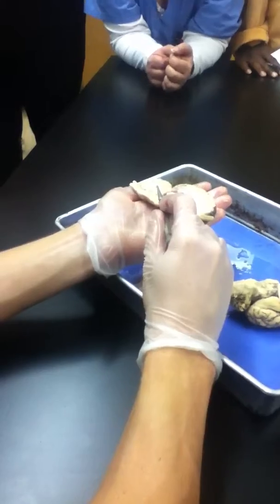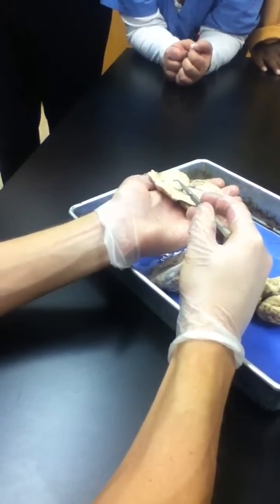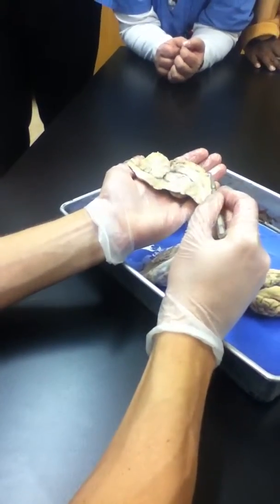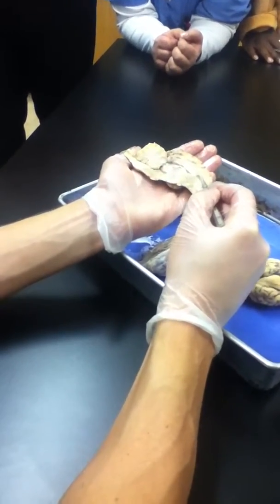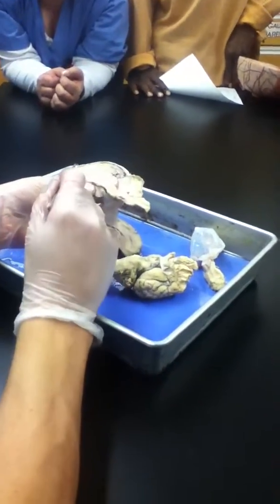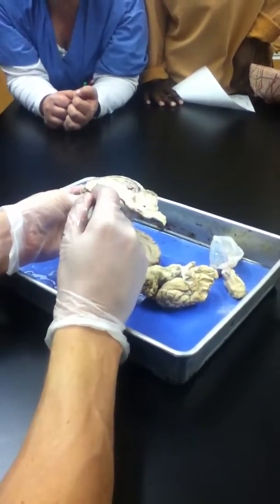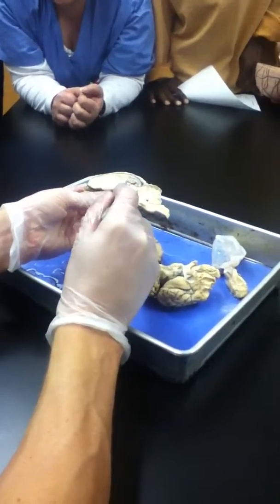Now, notice how that was white matter. You can clearly see the difference between outer gray and inner white matter. And because they went a little off-center with their slice here, you can actually see the difference between gray matter here and lighter white matter here. Now, it wasn't perfectly dissected. It's a little better on this side. And you can see, again, gray matter and white matter distinctions, right? Darker gray, lighter white. Notice the specific shape of the white matter forming a curve here.